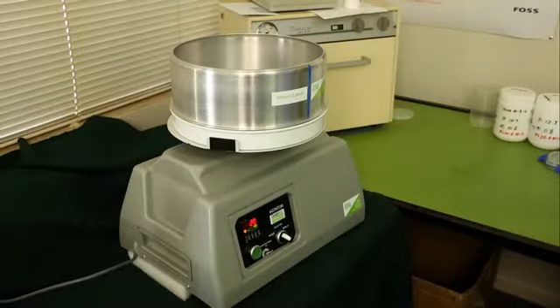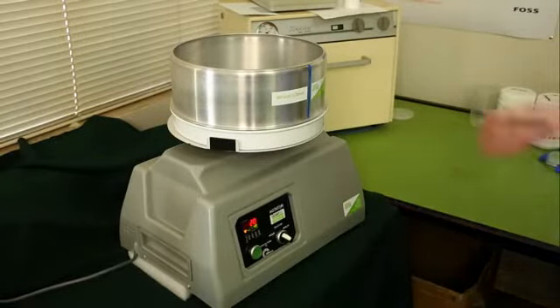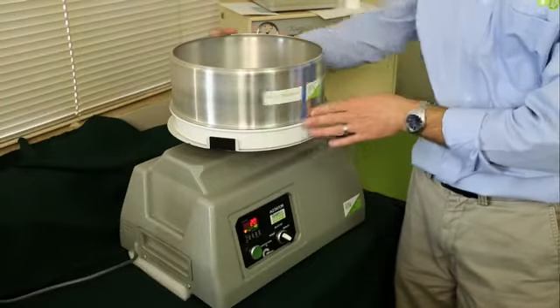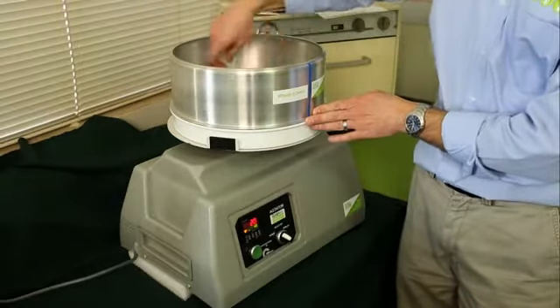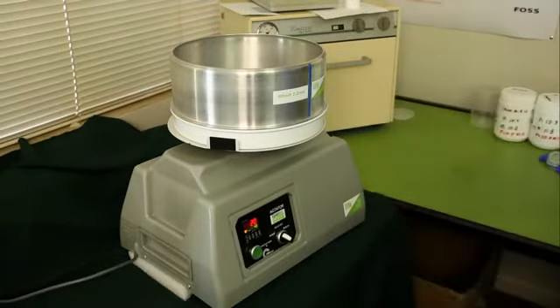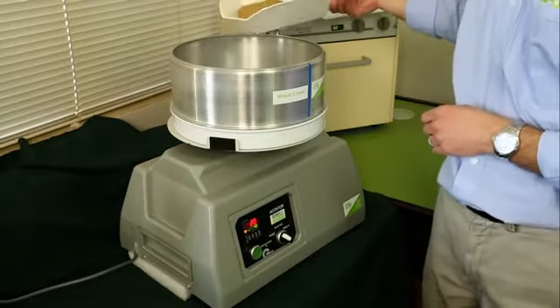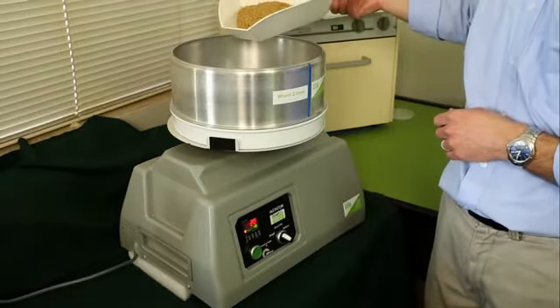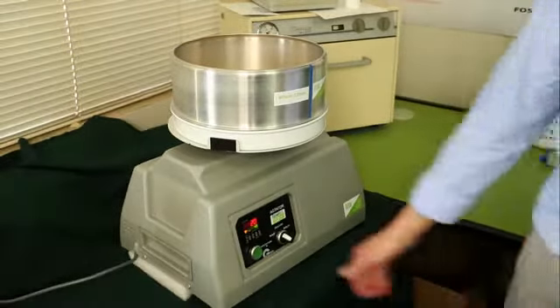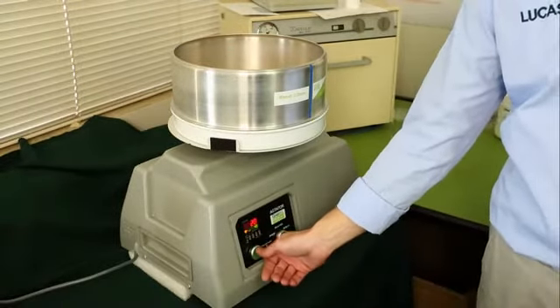If you're using an automatic shaker, the process is the same. Ensure that your sieve has the stripe facing the front and slots in the shaking direction. Pour in your 500 mL sample, having weighed it first. And press the start button.